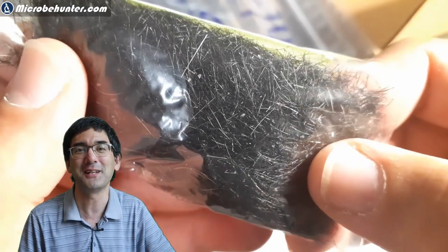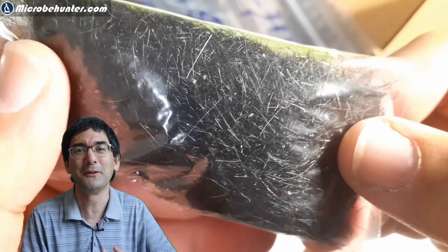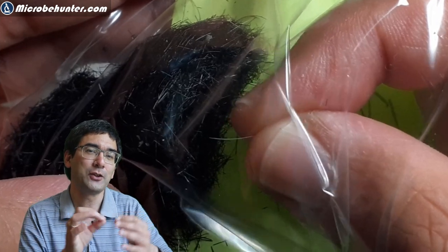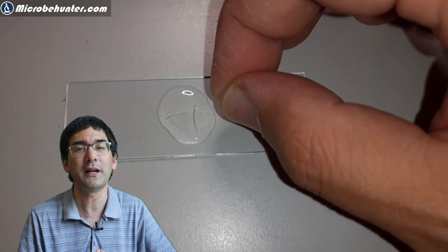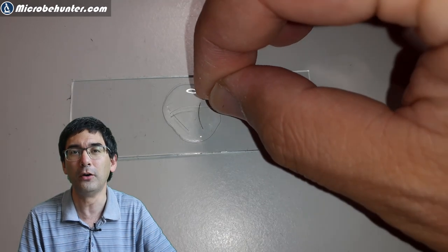Honestly, I don't know if it's going to be successful, but this should explain why I'm doing this. Well, of course I had to pick up those few white hairs that I could find and I put them directly on a microscope slide into a drop of water.